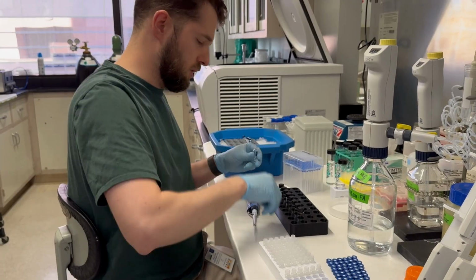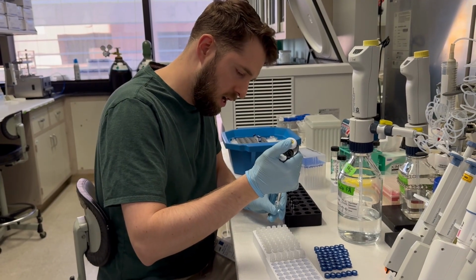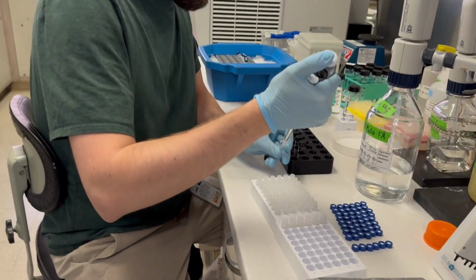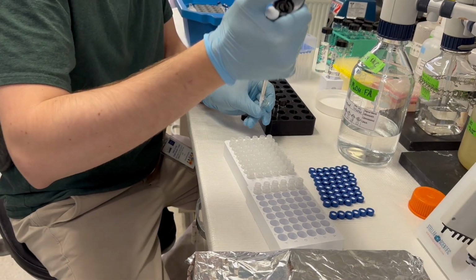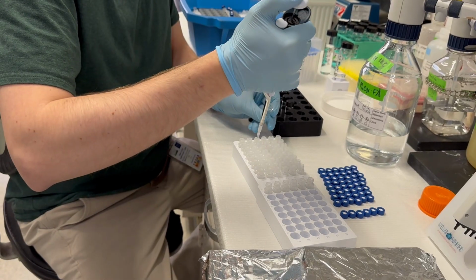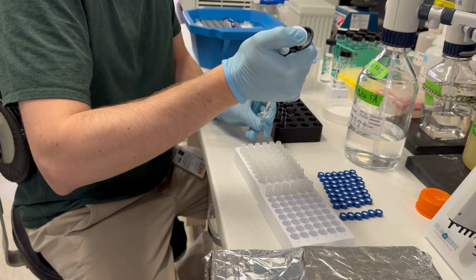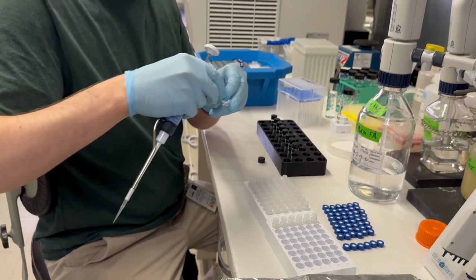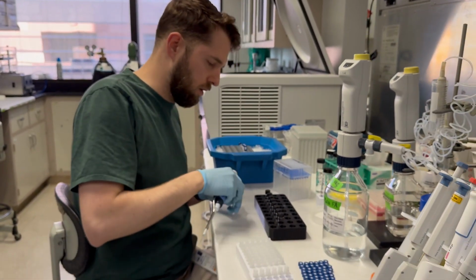All right, so we'll start with our stock vial. And again, the concentration is set at this point, so if you get a little bubble or something, you don't have to worry about it too much, but try to be as accurate as you can. Yeah, and you can see, I just finished the 6th one, and there's just a little drop left over, not really enough for a full vial.